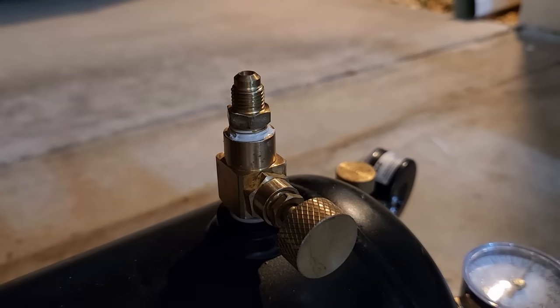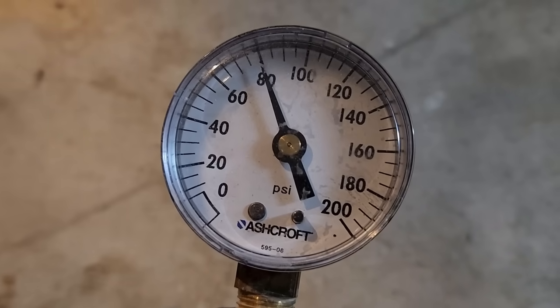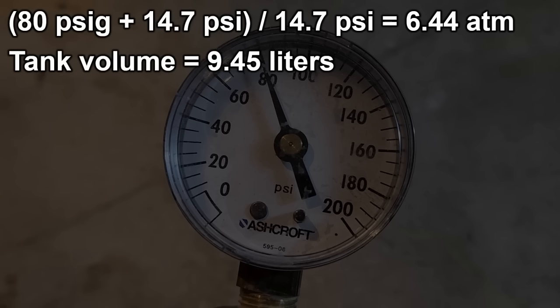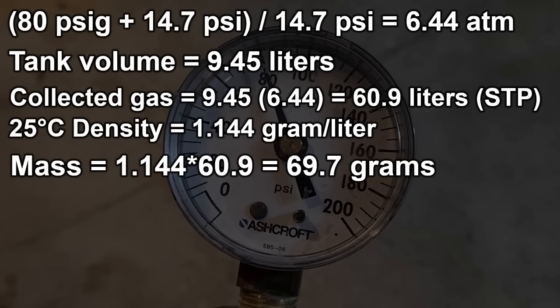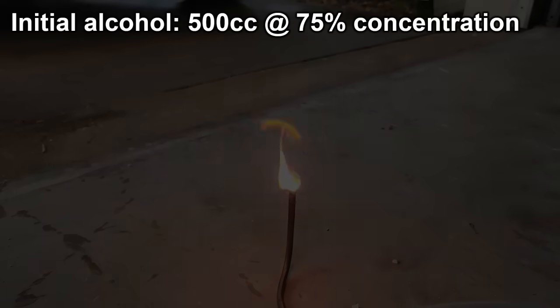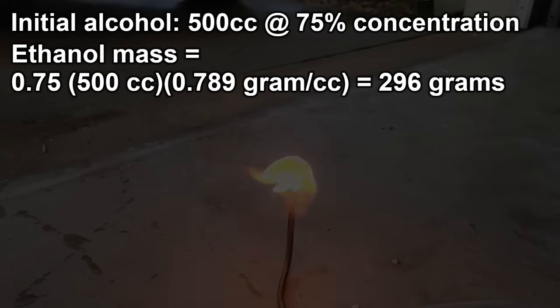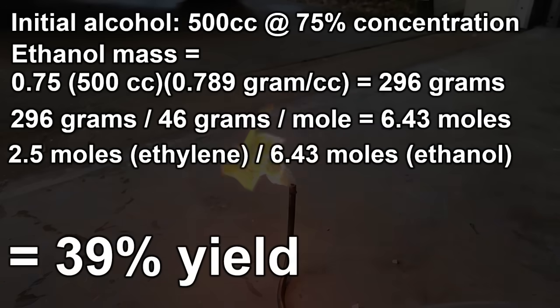Now the tank is full so I shut off the valve and disconnect the fill hose. The tank settled out at 80 psi, which translates to 6.44 atmospheres of absolute pressure. The tank has an internal volume of 9.45 liters, so we've collected 60.9 liters of ethylene at standard temperature and pressure. That comes out to 69.7 grams of gas or 2.5 moles.